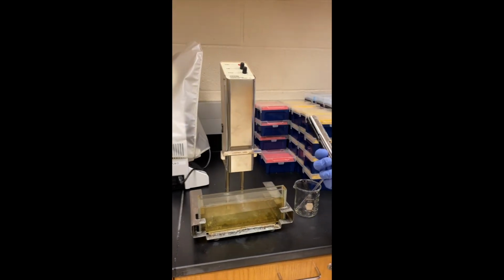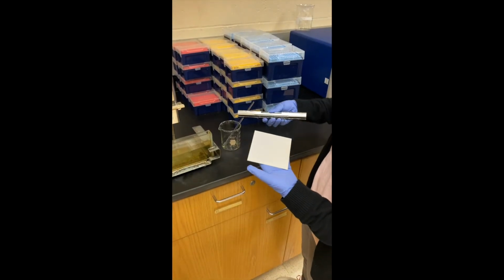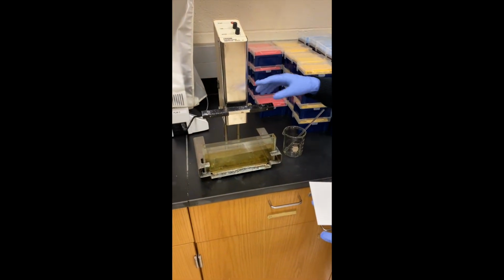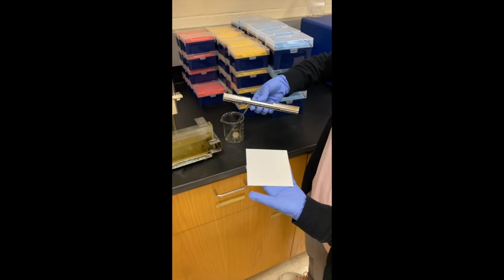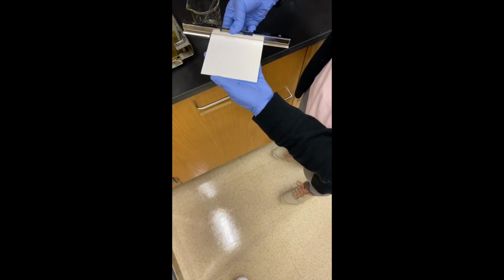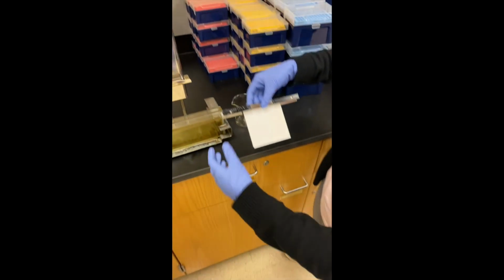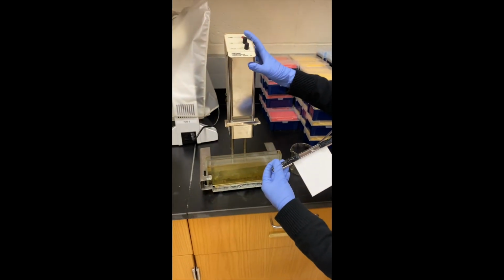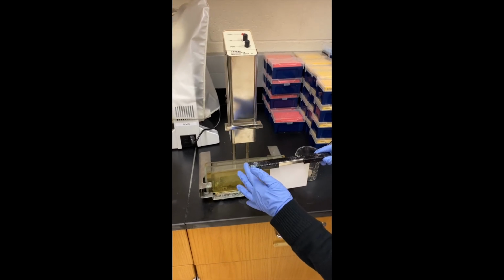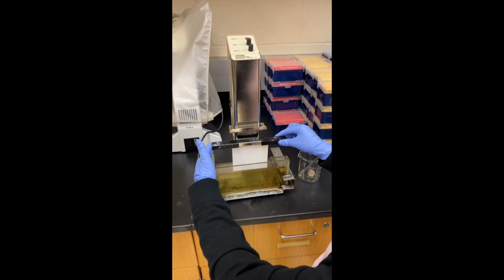We can take this off, so we will be able to clamp your plate onto here. So we have the plate and we have the clamp. It was on the instrument like this, so just directly grab it and pinch it so the top layer goes down. Put the plate all the way in and then release it, so it clamps the plate on there. Because this is broken, the wire is not working, so I'm manually dipping it, counting to 5, and then pulling it up. Just remember to go down slowly.